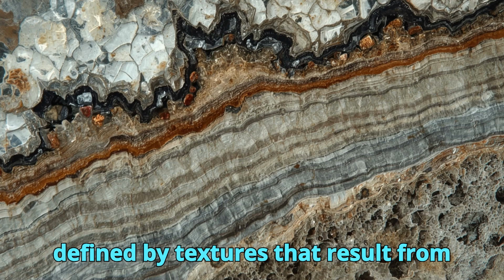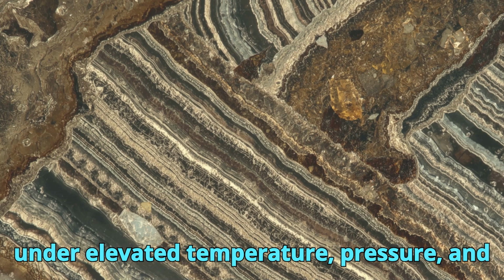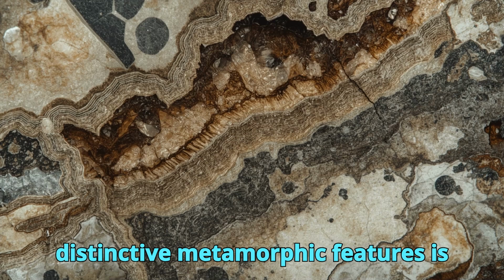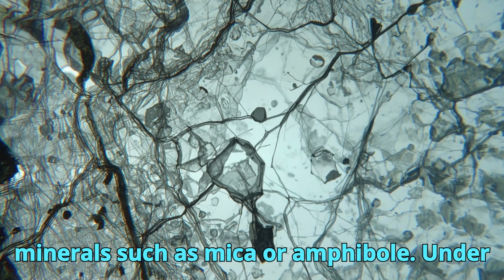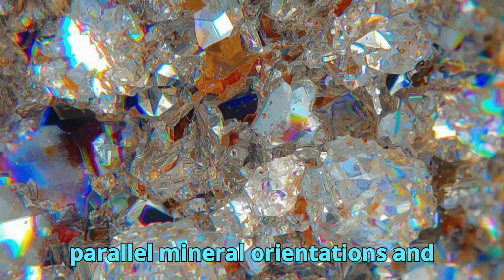Metamorphic rocks are defined by textures that result from mineralogical and structural changes under elevated temperature, pressure, and differential stress. One of the most distinctive metamorphic features is foliation, a planar fabric formed by the alignment of platy or elongate minerals such as mica or amphibole. Under the microscope, foliation appears as parallel mineral orientations and compositional banding.